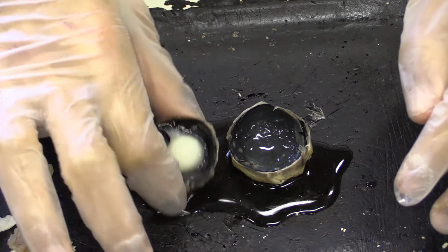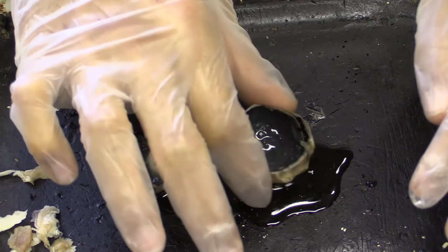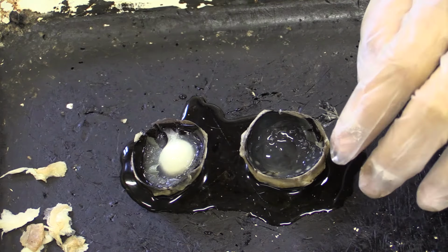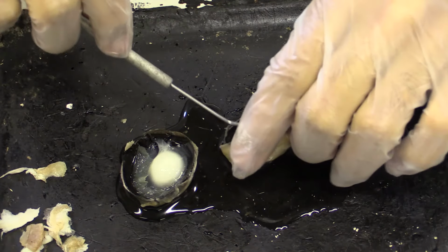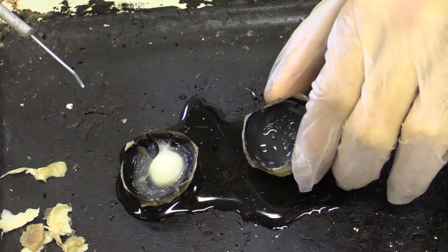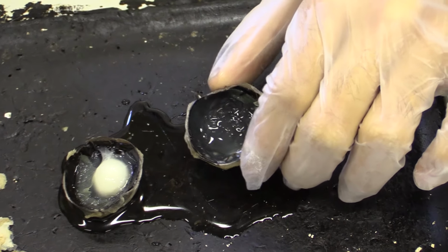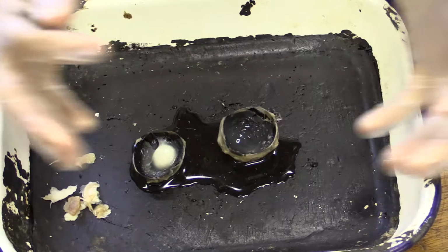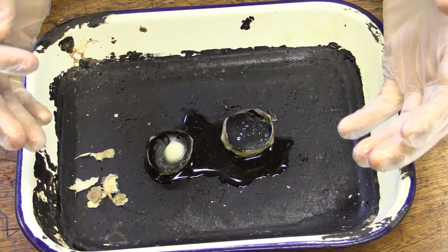Here we have the anterior half of the eye, which is known as the anterior 1/6. Then we have the posterior part of the eye, which is known as the posterior 5/6. And all this liquid, as I said, is aqueous humour. But in here we have a little bit of jelly, which is known as vitreous humour. And that vitreous humour is really important because it actually acts as a method of pushing against the sclera, the wall of the eye, and giving it rigidity and support.